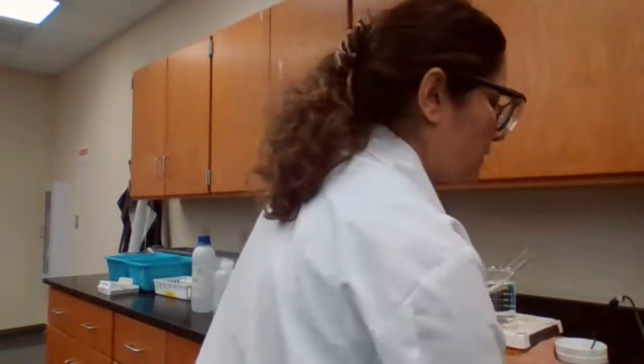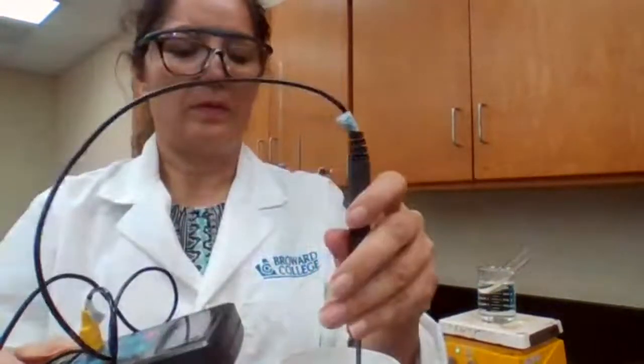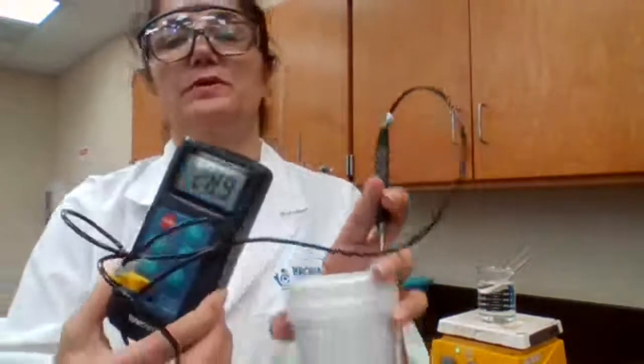I have to wait for the highest temperature to reach for water. And when the temperature starts dropping, I record the number. So right now it's 28.9.